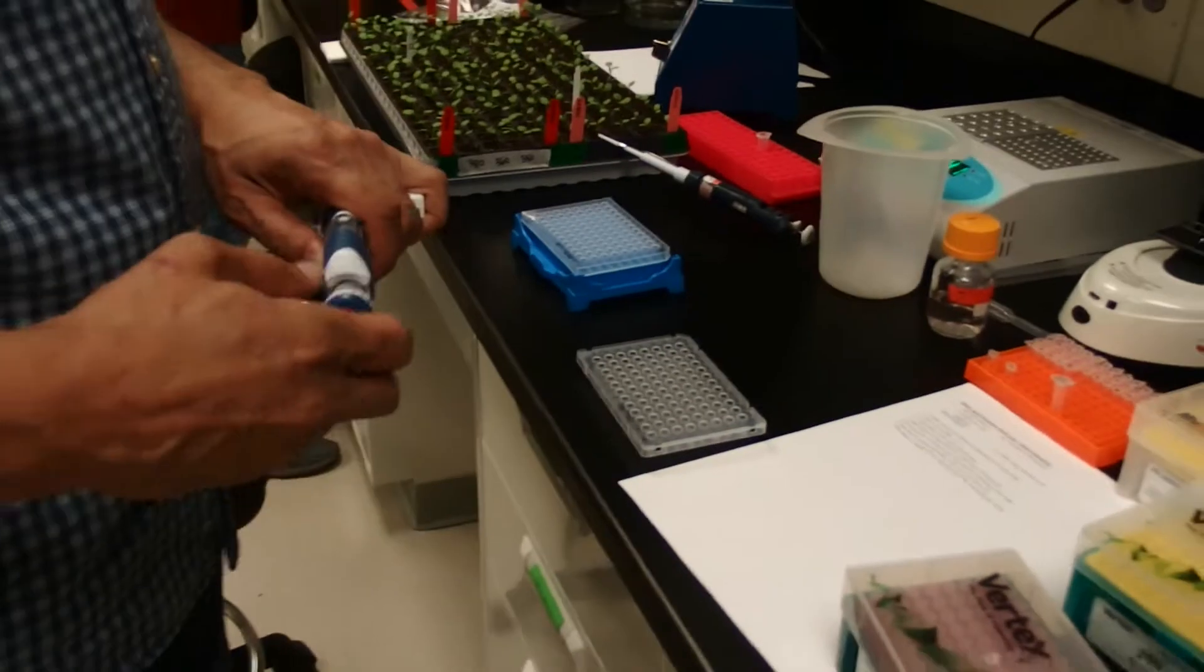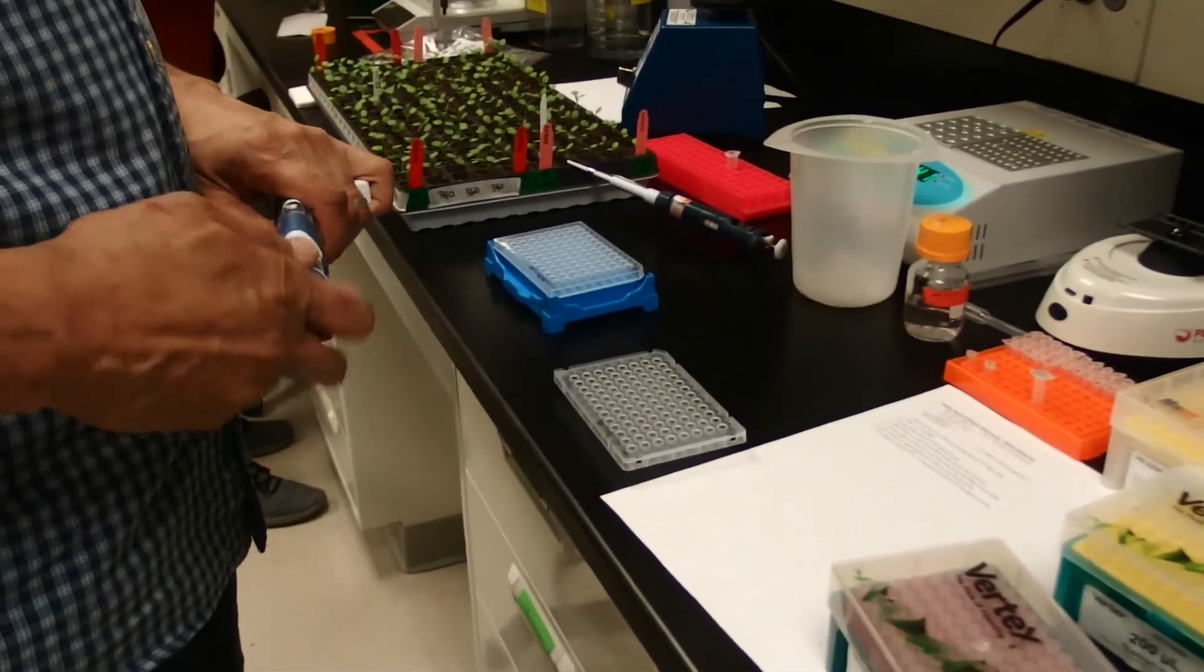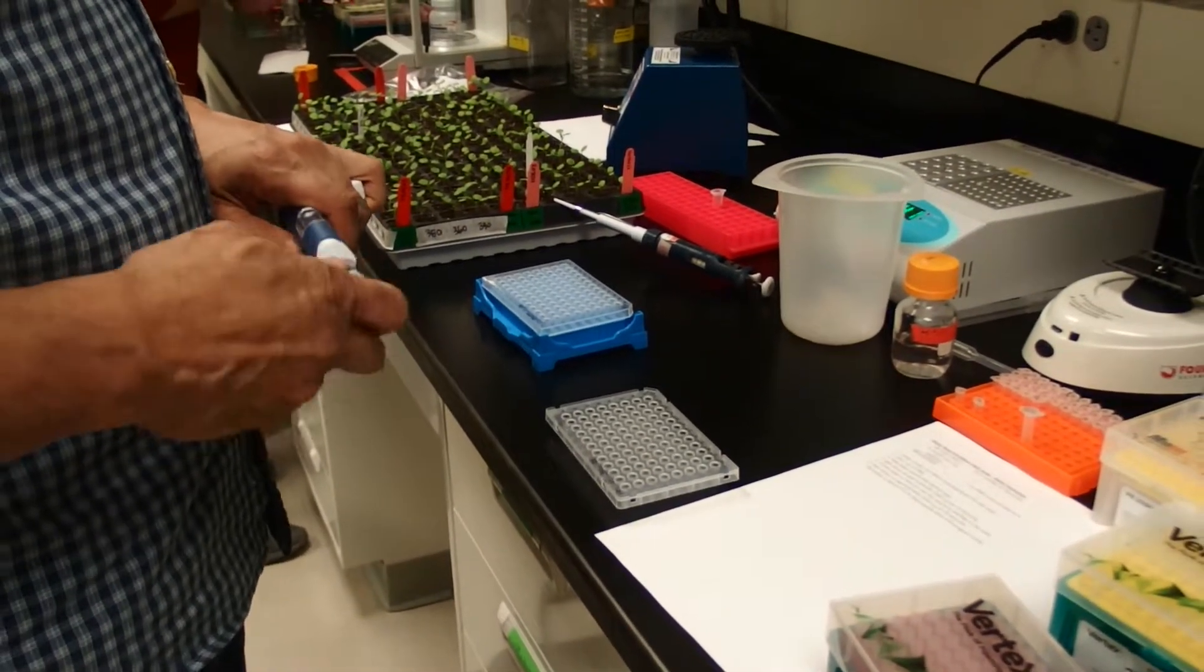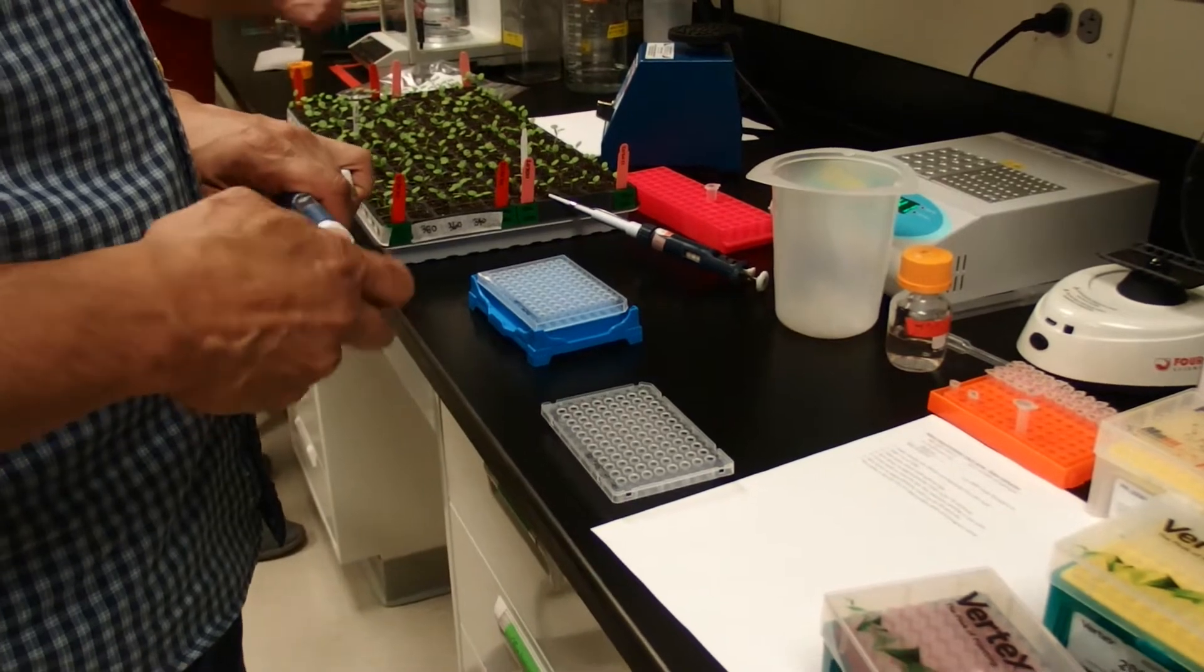Now we've got to move one microliter of template over into this genotyping plate.